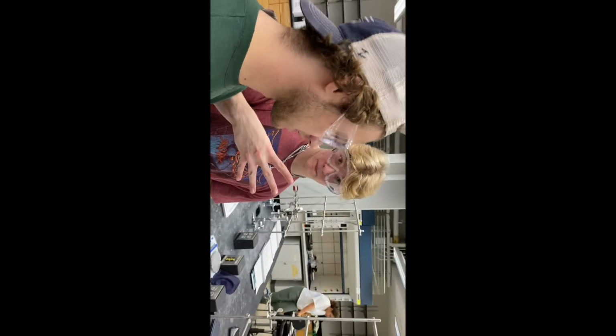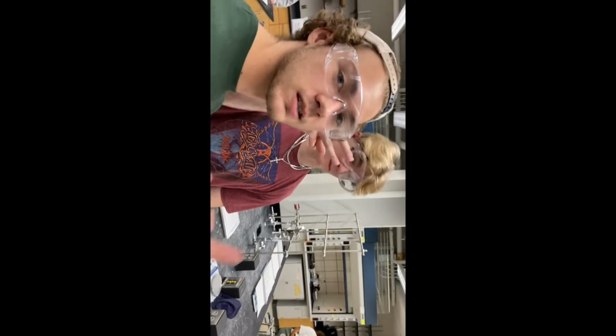What we doing? So you have to measure out 0.125. What we doing? So you need to get 0.125 grams of that salty stuff. The salty stuff. All right.